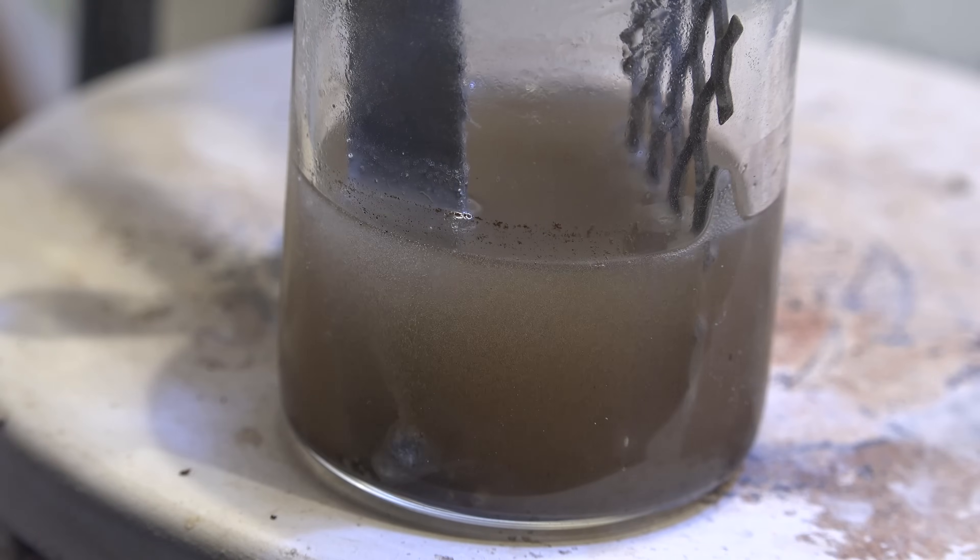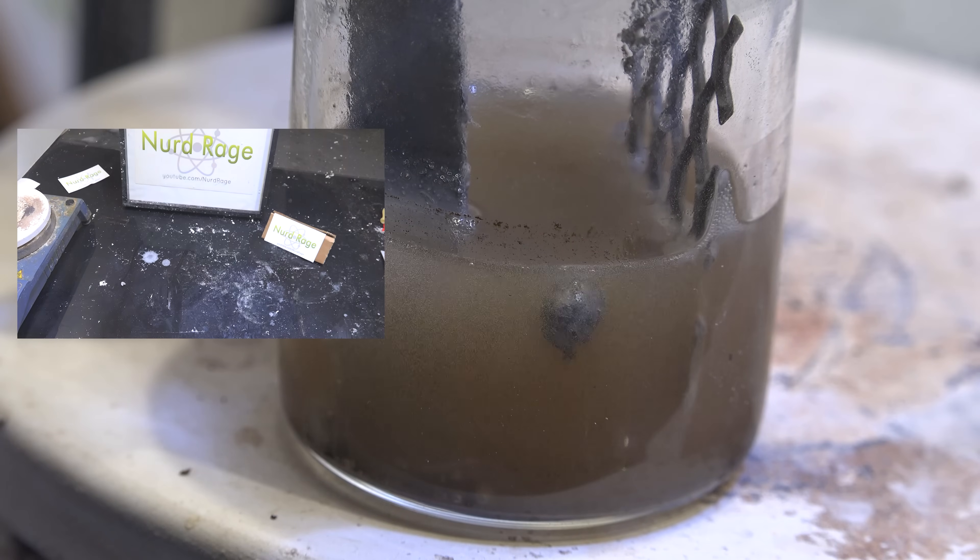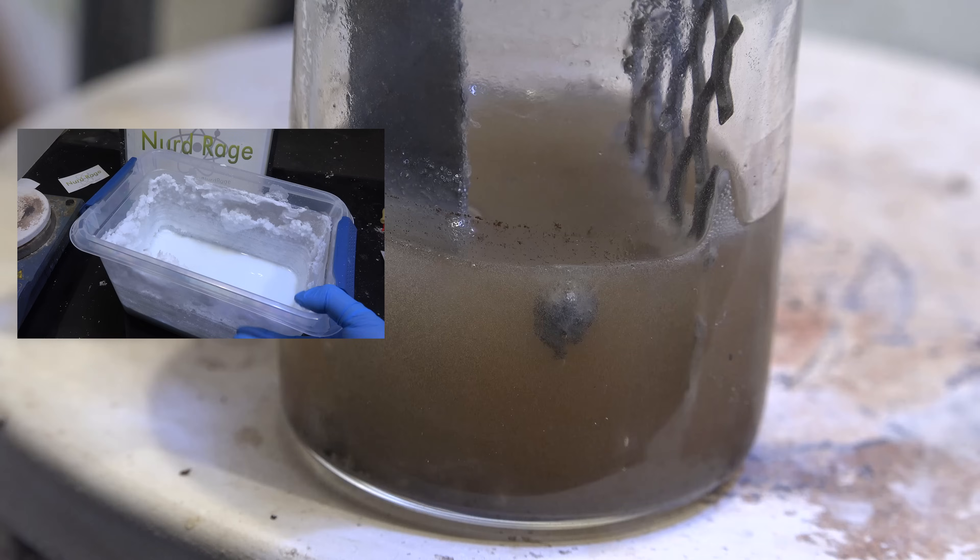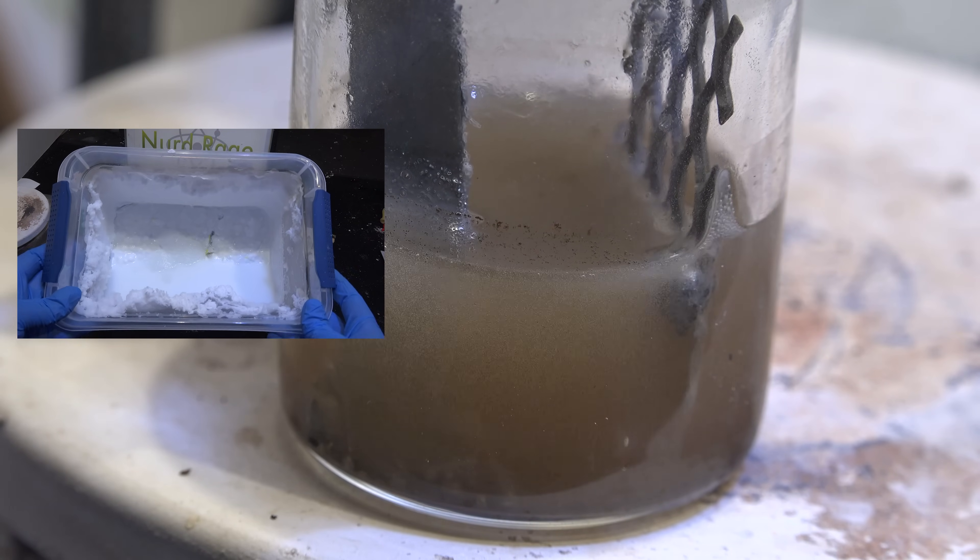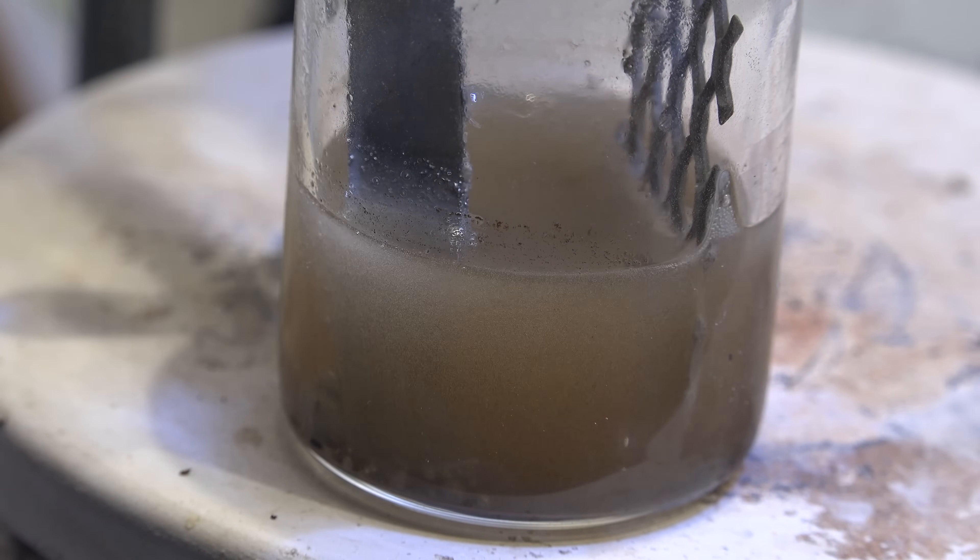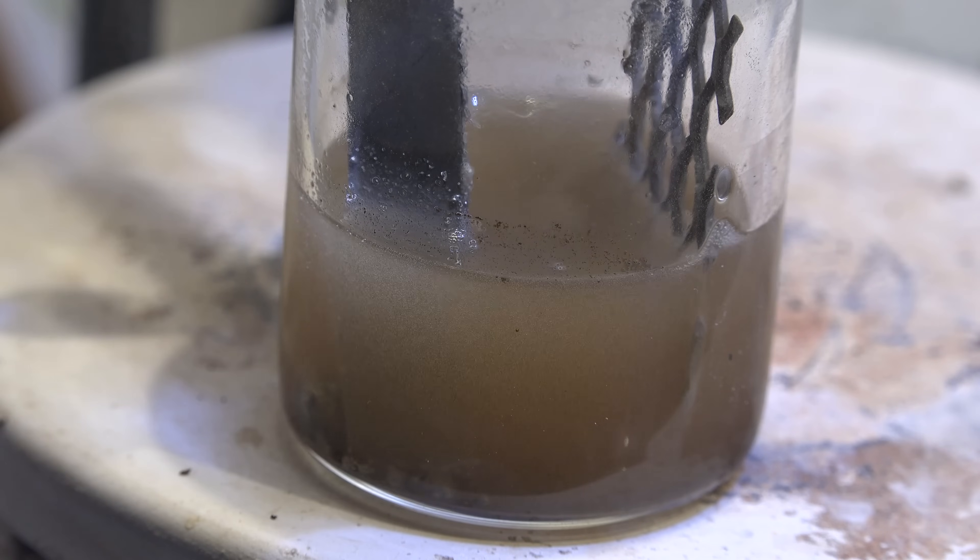I think it's amazing to actually see a liquid metal electrolyze at a solution. Now you might be asking why we didn't do electrolysis on the bulk waste. This is because the gallium concentration is far too low. We need the solvent extraction to separate and concentrate the gallium so that it would be recoverable by electrolysis.